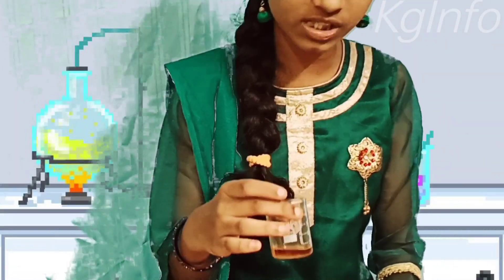Now let's step into the procedure. I have already prepared the diluted iodine solution. For that I took 10 ml of water and added 3 to 4 drops of iodine solution, until it turns into a pale light brown color. So the diluted iodine solution is ready.